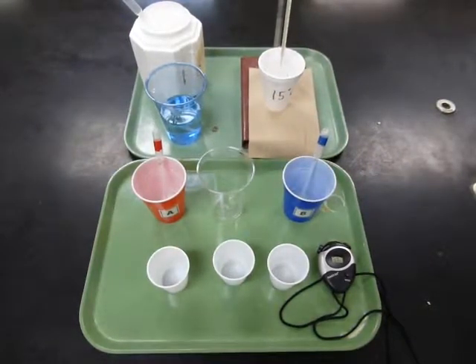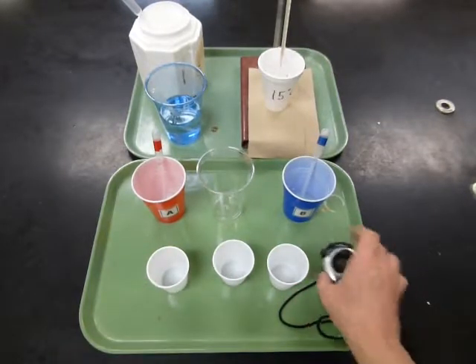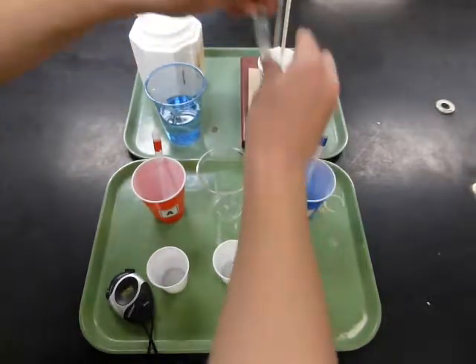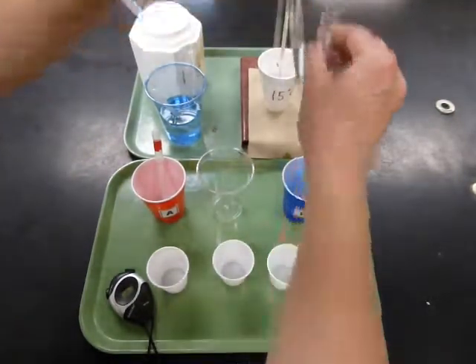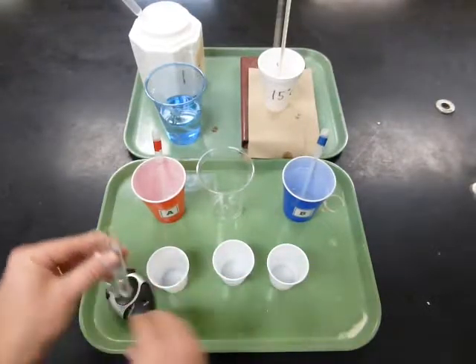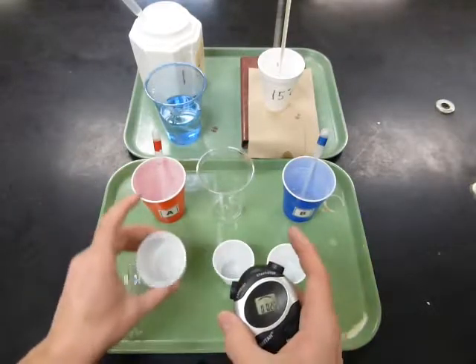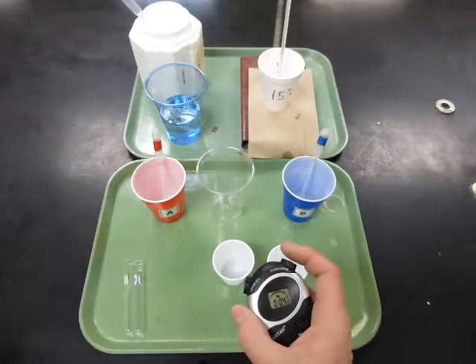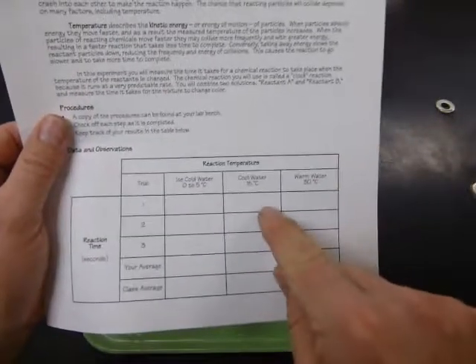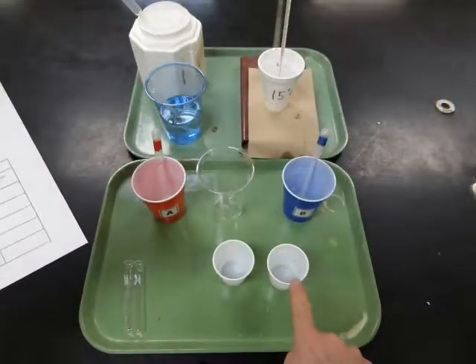Now, after the temperature has gotten down to 15 degrees, we'll do 3 trials of the reaction. Have someone ready with the timer, and then take a tube of B and a tube of A, and be ready to pour them together into 1 cup. When you pour them together into the cup, start the timer, and when it turns blue, turn the timer off. And record on your copy of the data table the time of the reaction. We'll do 3 trials, so for each of the 3 cups, a different trial.